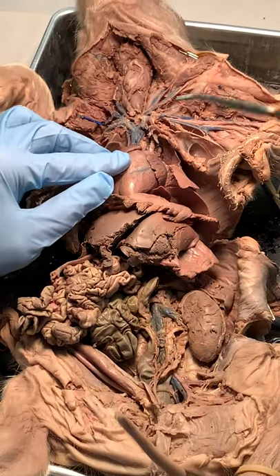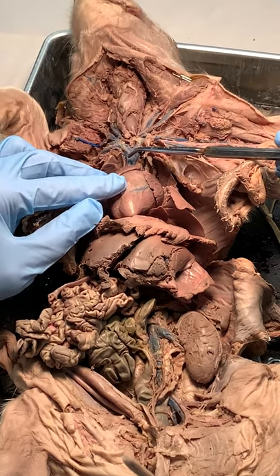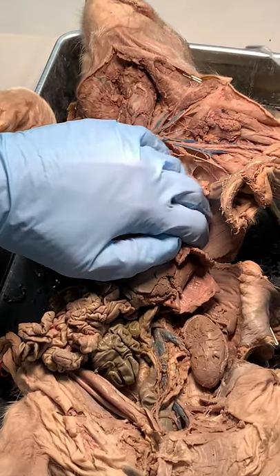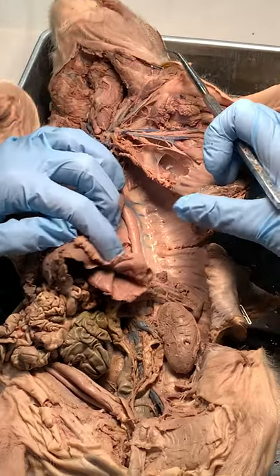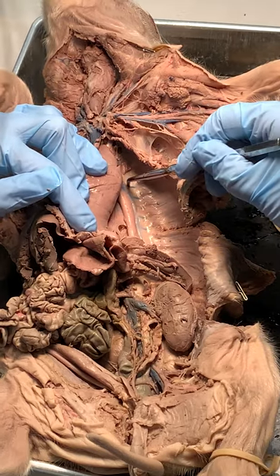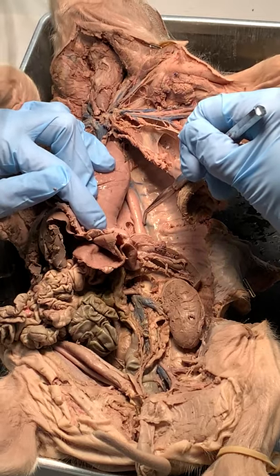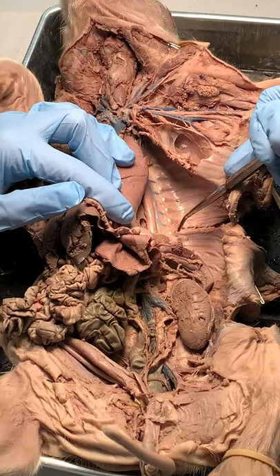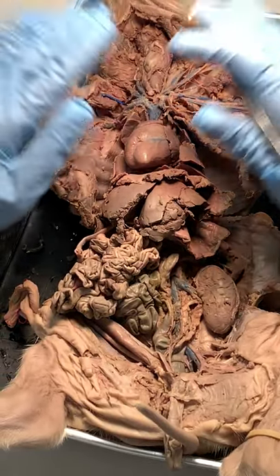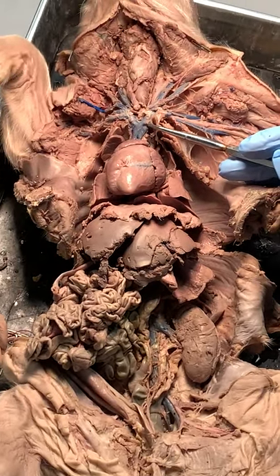Now I'm going to go to this one — this is the anterior vena cava. Off of the anterior vena cava, the only one that's singular by itself — meaning it doesn't have a twin — is the hemi azygos. So here's the descending thoracic aorta, and here would be our hemi azygos running down with it. That's the only one like that; everything else is a match. Now let's go up to the brachiocephalic trunks.